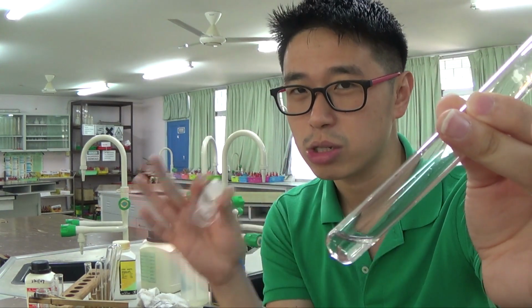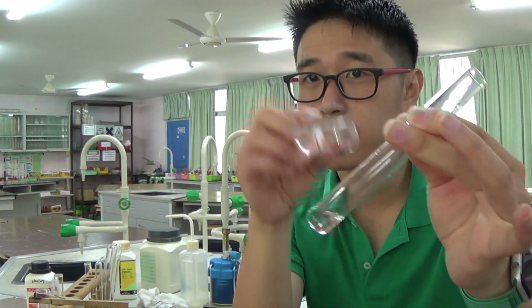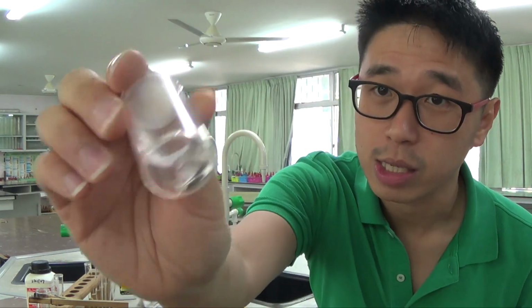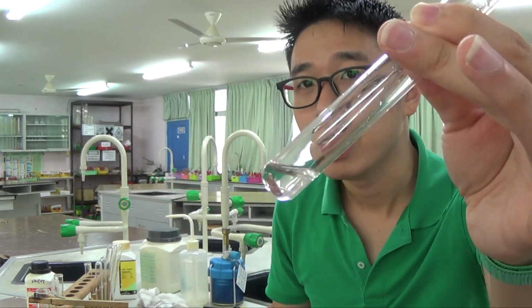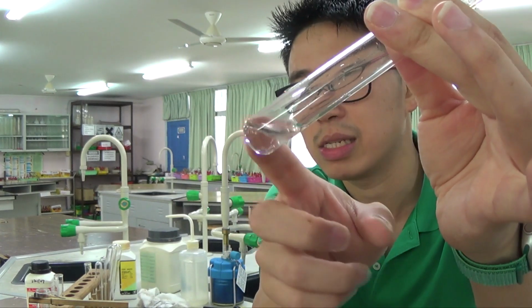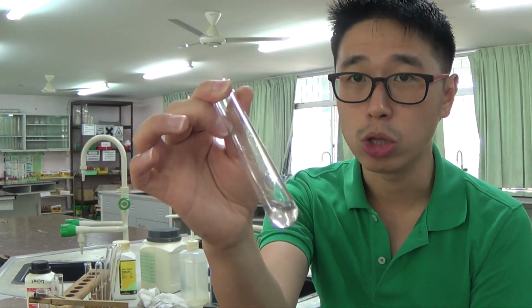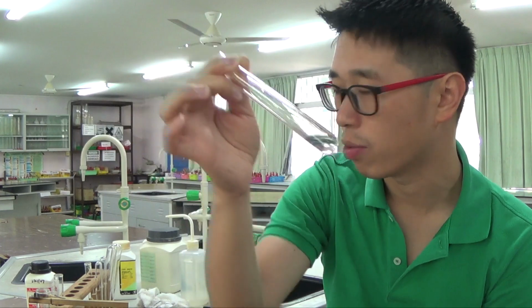If I test for nitrate straight away, I will have aluminium foil with sodium hydroxide. Sodium hydroxide and aluminium straight away would give me ammonia gas, not because it has nitrate, but because the aluminium will not react on its own since there's no nitrate, but this ammonium chloride will give you an ammonia gas that will turn red litmus paper blue as well. So unless you did exactly what we did with ammonium nitrate, you test for the ammonium ion first for this ammonium chloride.